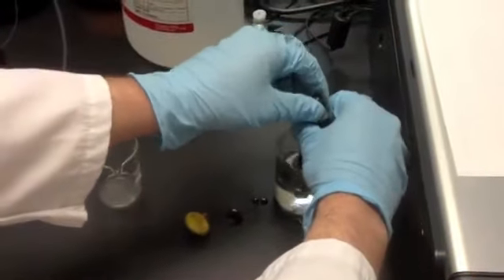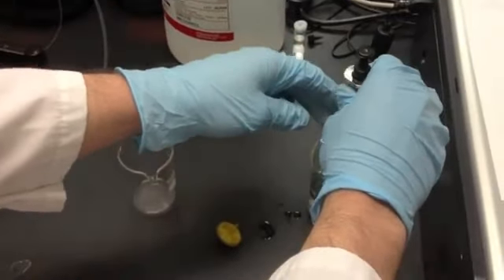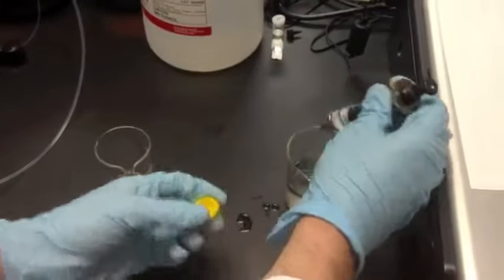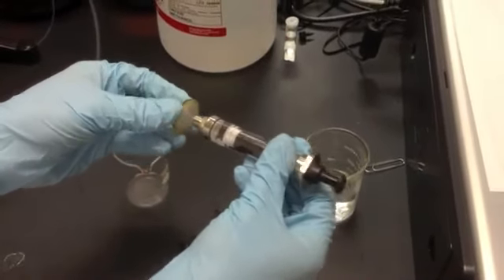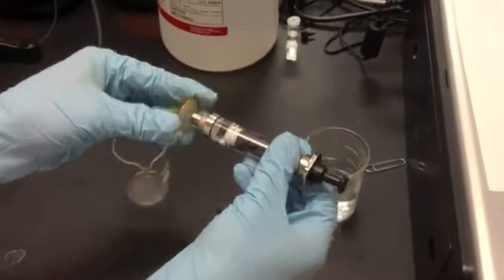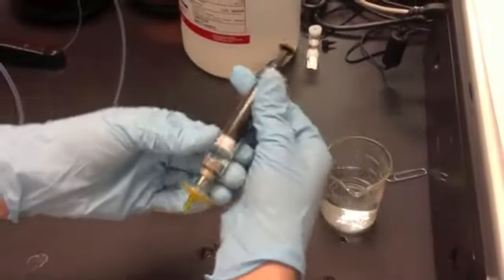Now take another portion, draw it up into the syringe, and we're going to filter it. Just attach this filter onto the end, just push it on, and you can spin it, spin until you feel a little bit of resistance. Now it's snug, so we're all ready.